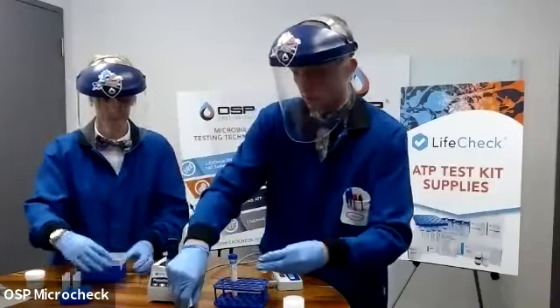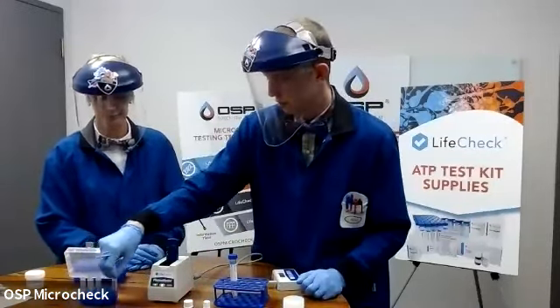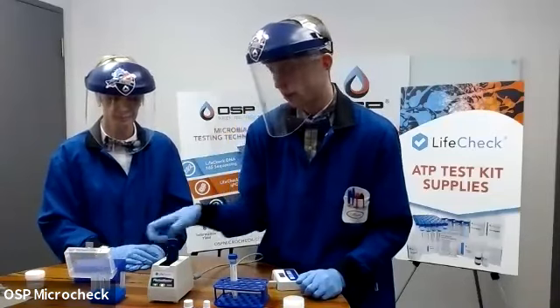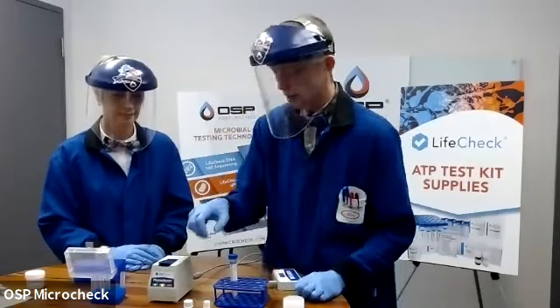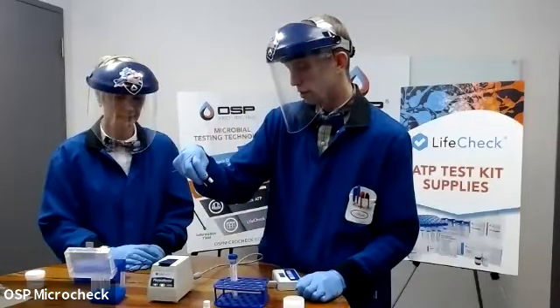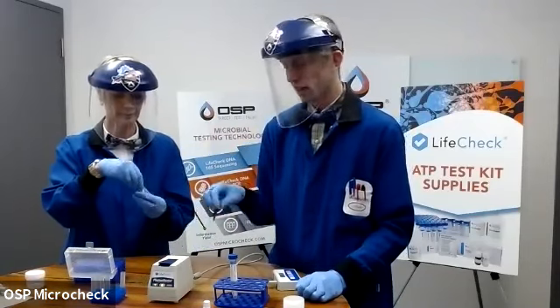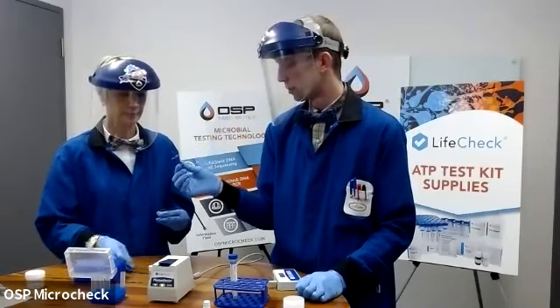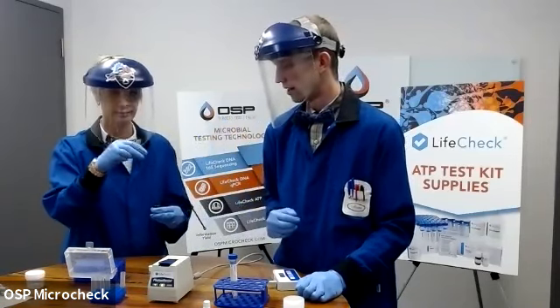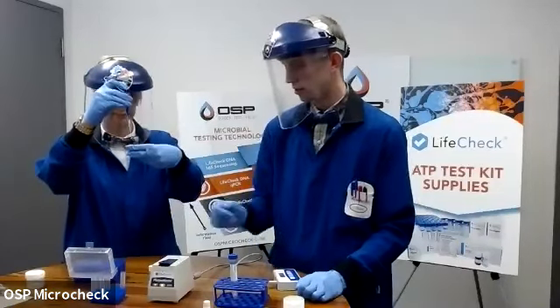And the next step here is going to be our positive control. So I'm going to take my assay tube and just place it back into the corner of my rack here. Again, best practice isn't to pipette directly into the machine. And Virginia is going to help me out first by pipetting 100 microliters of the enzyme, the reagent Z, into this assay tube. Once more, we have a preset micropipetter that is going to move that 100 microliters of fluid from this bottle into our assay tube.